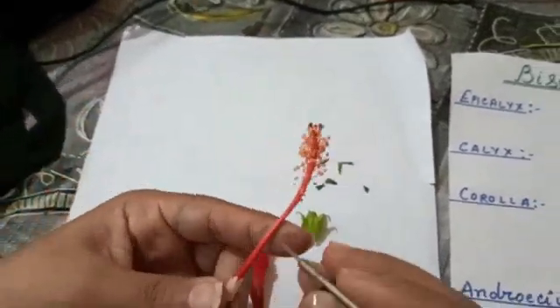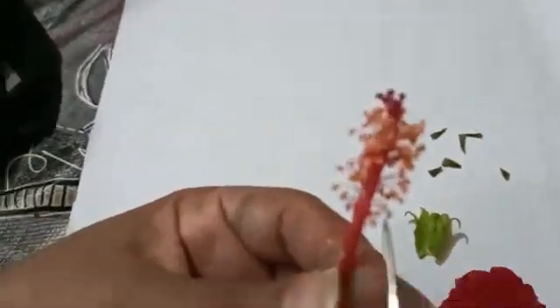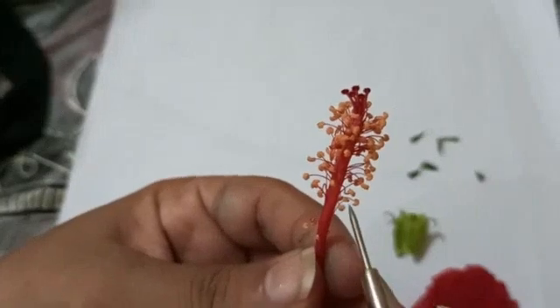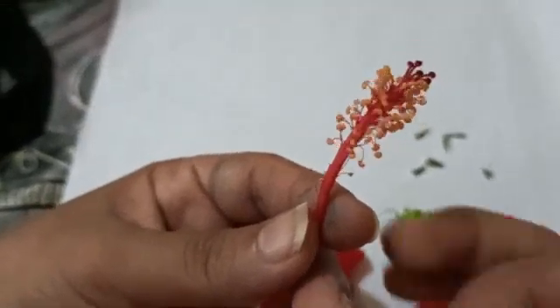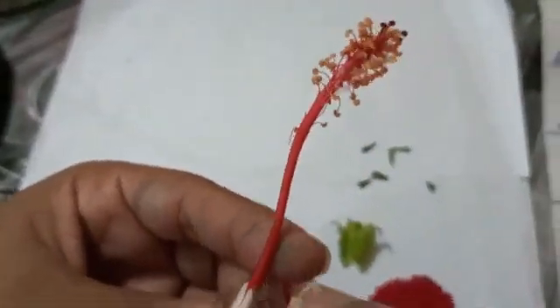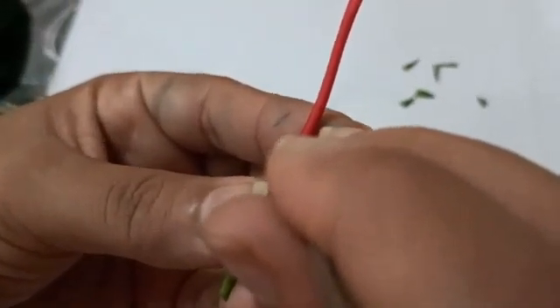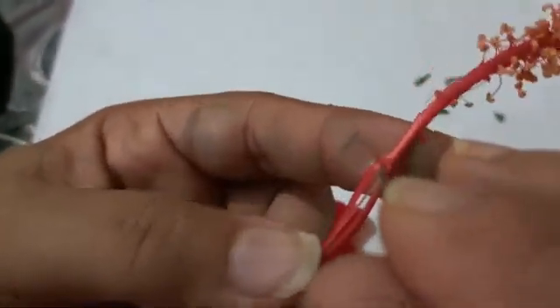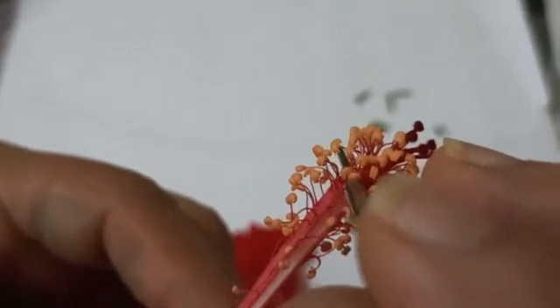Now we have this part — it looks like a style but it is actually a structure responsible for attaching all the anther lobes. This is an anther lobe, this one is an anther lobe — there are so many anther lobes attached to this tube-like structure. This condition is monadelphous. Monadelphous means all the anther lobes — more precisely, all the stamens — are fused from the filament to make a group.